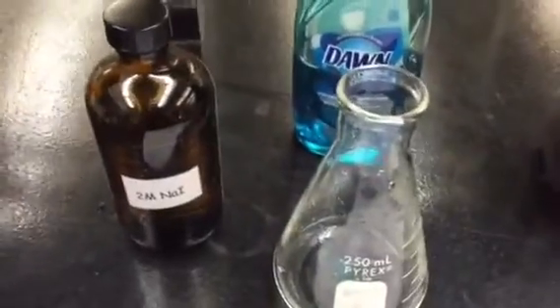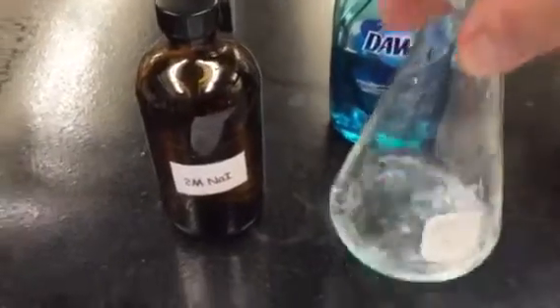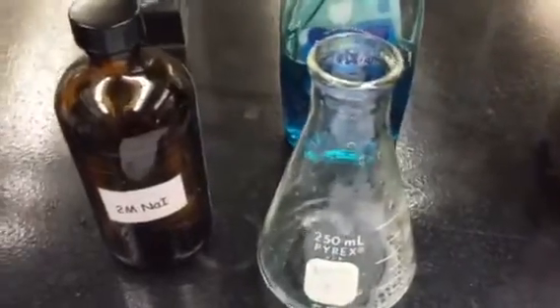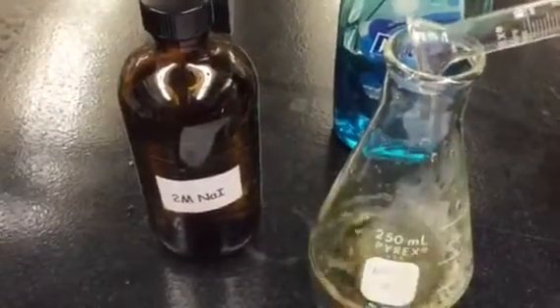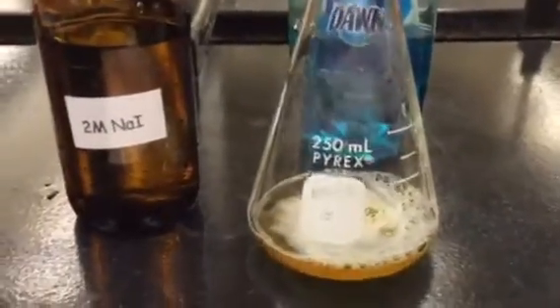The importance of the soap is that it allows a foam to be created when the reaction occurs and the oxygen is liberated. It's a closed cell foam so that none of the oxygen escapes. So it's a very elegant, simple way to gauge what the volume is of the final foam, and therefore calculate the number of moles of oxygen consumed and created.